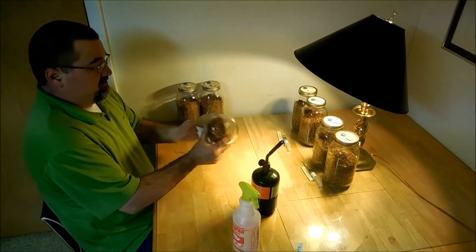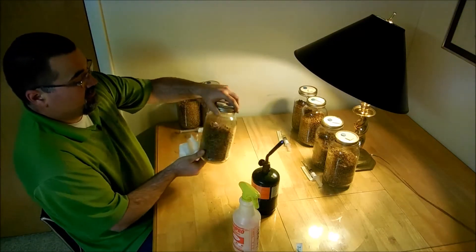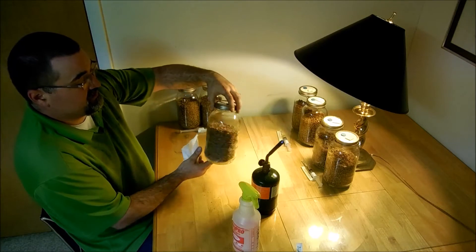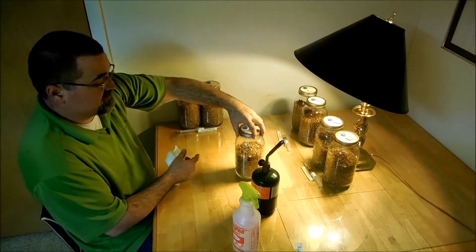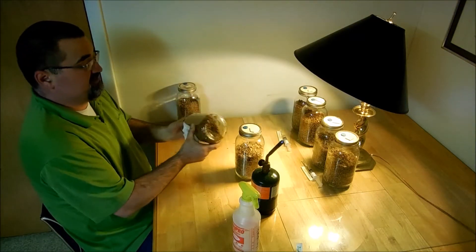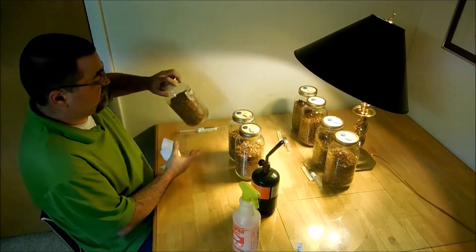So this is the rye grain spawn, or rye grains rather I should say, that have been sterilized, and you can see in my previous videos one of the processes for doing that.